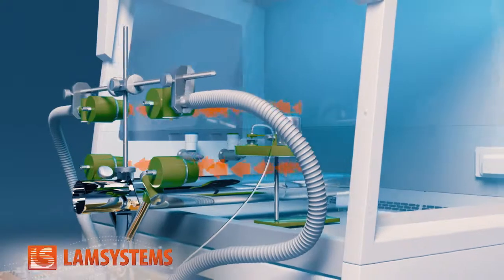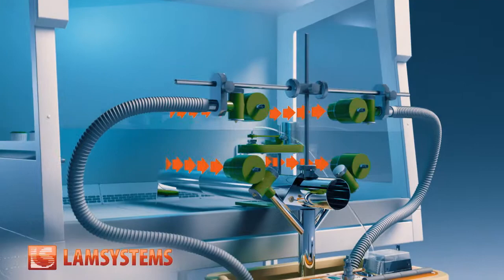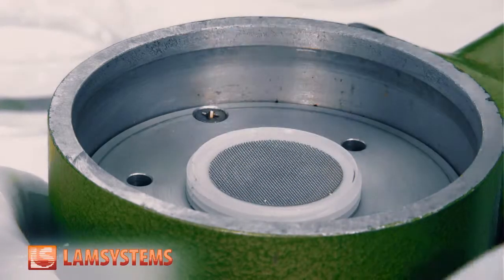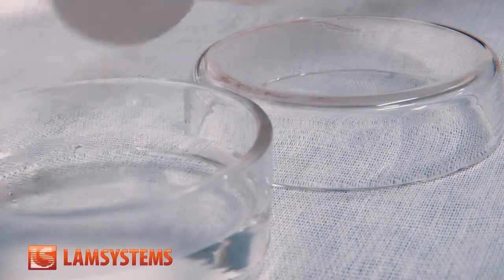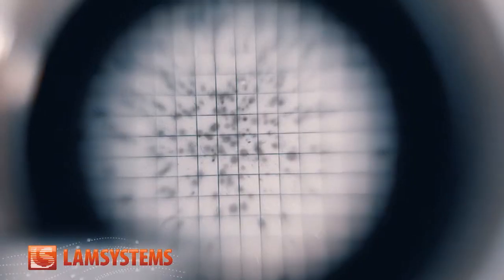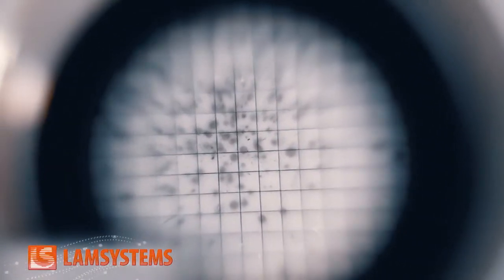Simultaneously, air samples are taken from the other side of the workspace opening by means of the suction specimen trap with membrane. Upon completion of generating the test aerosol, the filters are removed and placed in a special solution. When this happens, the particles of potassium iodide that settled on the filters appear as greyish-brown dots. The protective coefficient of the microbiological safety cabinet can be calculated by comparing the quantity of particles sprayed during generation of the test aerosol and the quantity of particles that settled on the filters.